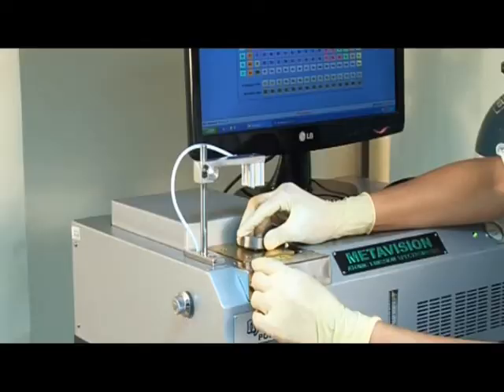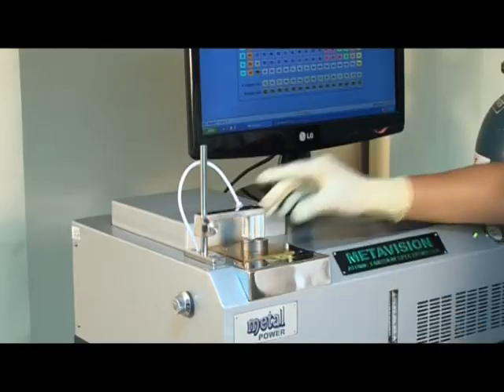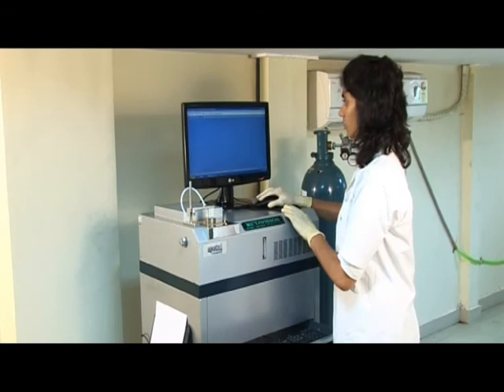A properly prepared sample is placed on the spark stand and clamped. The analysis is initiated.